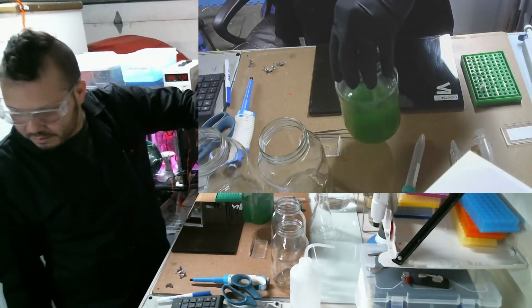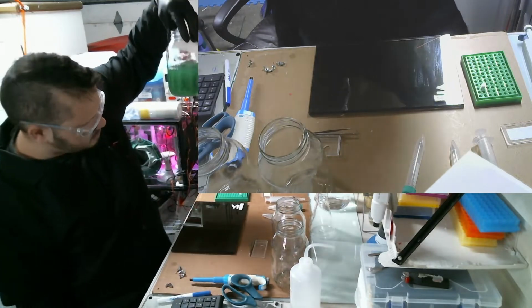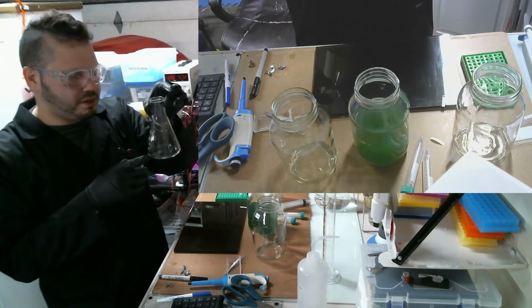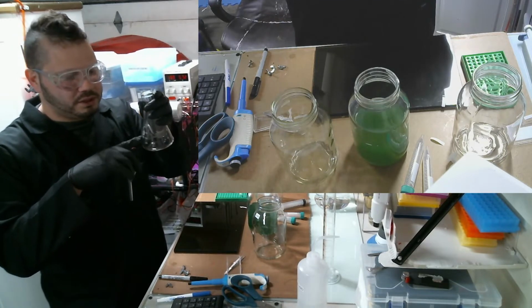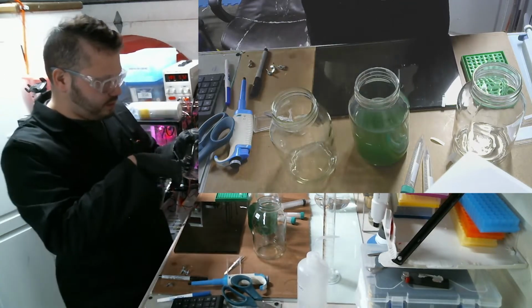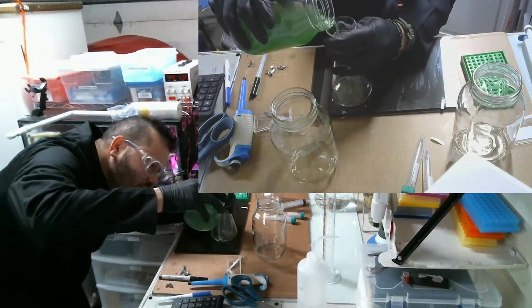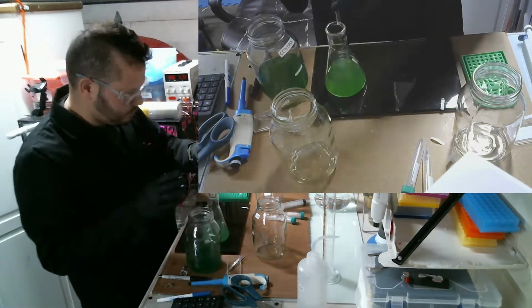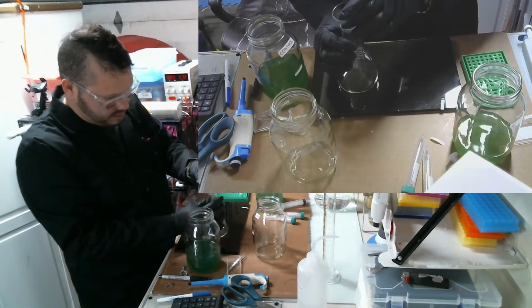Now it's always a good idea to mix this again, just to make sure nothing settles at the bottom. Now normally I don't measure things using beakers, however I've already pre-measured this using distilled water to ensure that it's exactly 157. That way I can fill it up to that line and then I can pour it into each. And that should be 10 million right there, give or take.